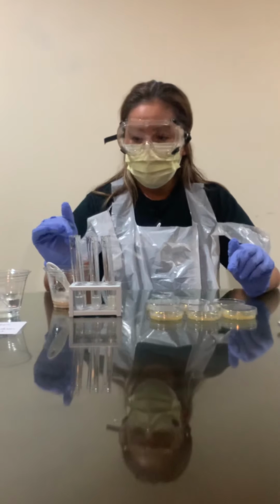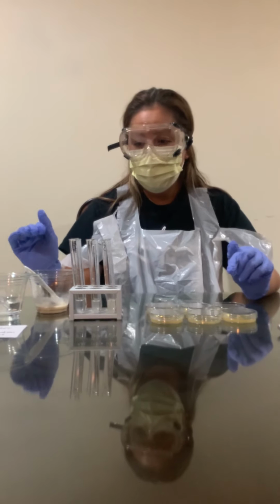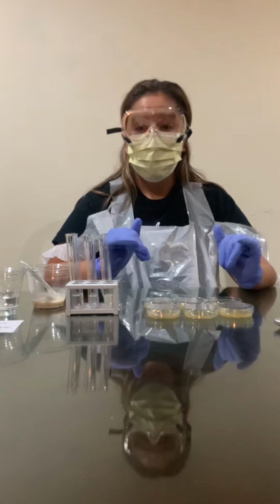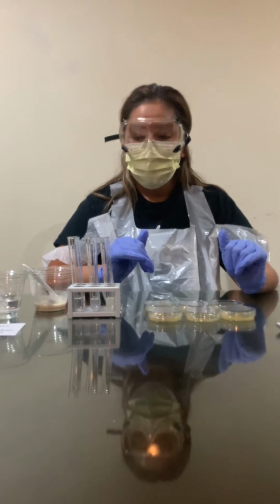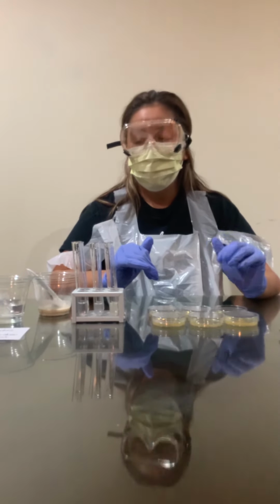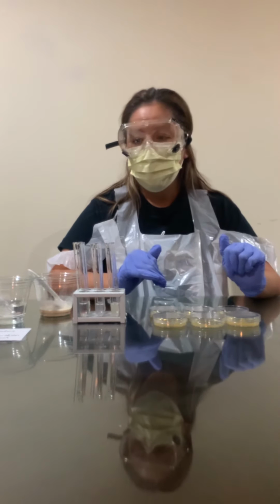I am gonna discard the water and the cerevisiae solution. I will wash the test tubes and disinfect everything else. I'm gonna wipe down my work area with 10% bleach and soak anything that needs to be discarded for about 2 hours. This concludes my Lab 3, bacterial enumeration, dilutions, and plate count. Thank you.